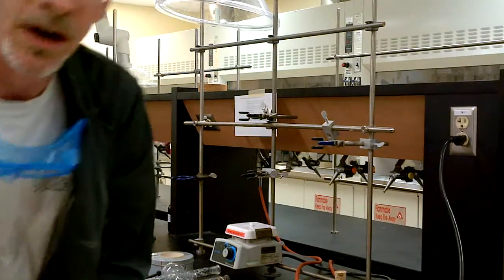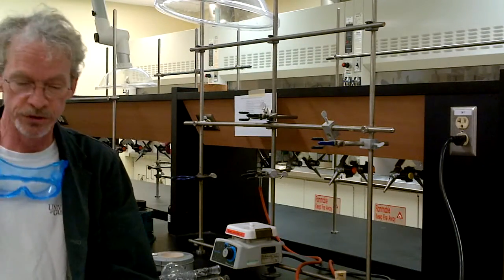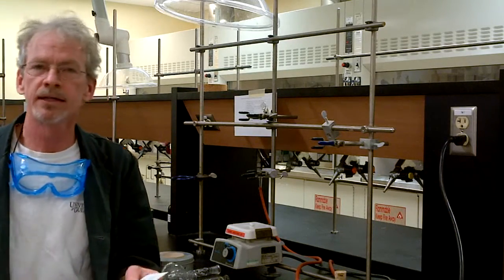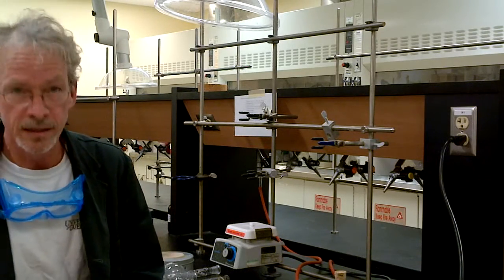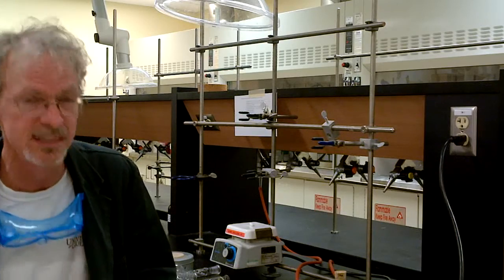Well, here we are back in the lab for week two of the nucleophilic substitution chemistry. We have made our product and hopefully Zach and Nick, Zach and Alex survived. Still week two, now we get to distill.